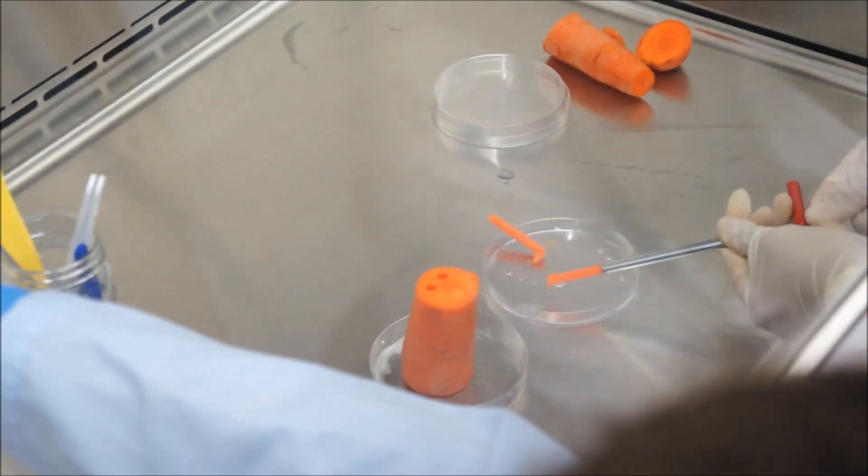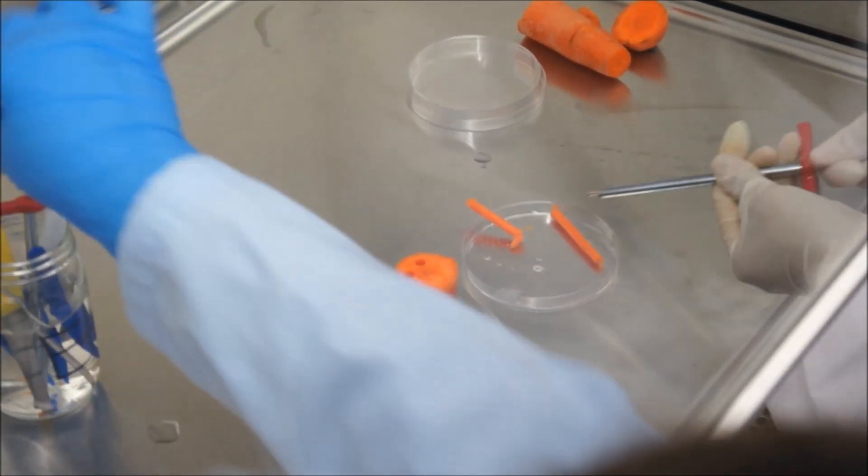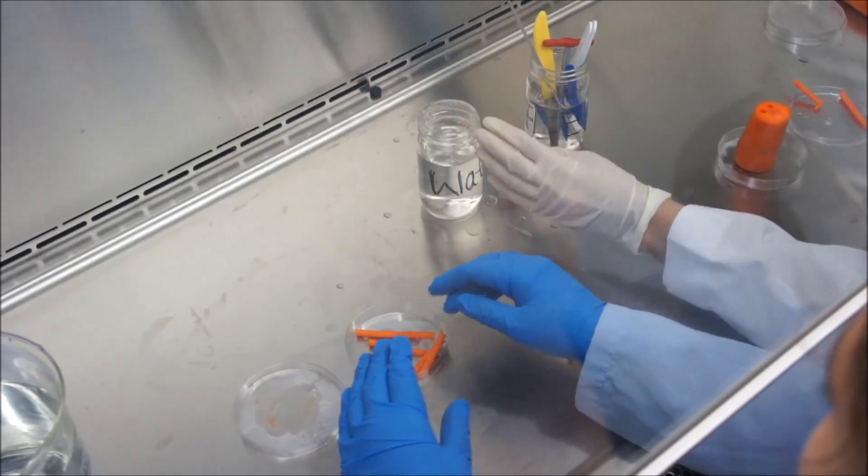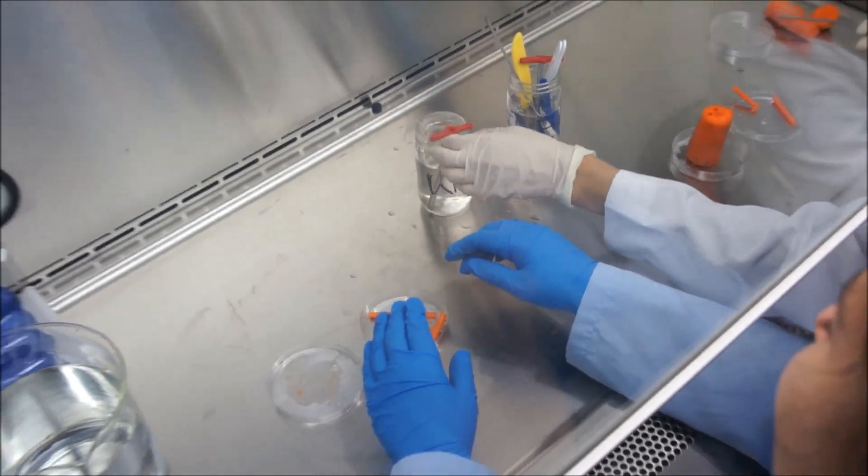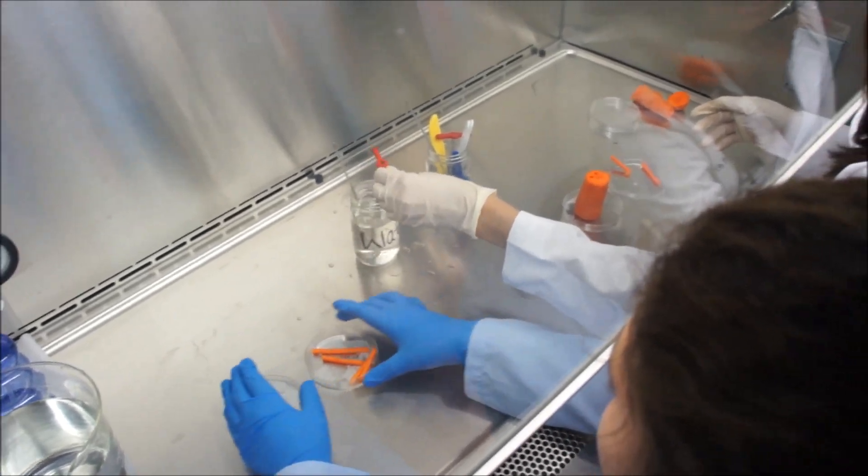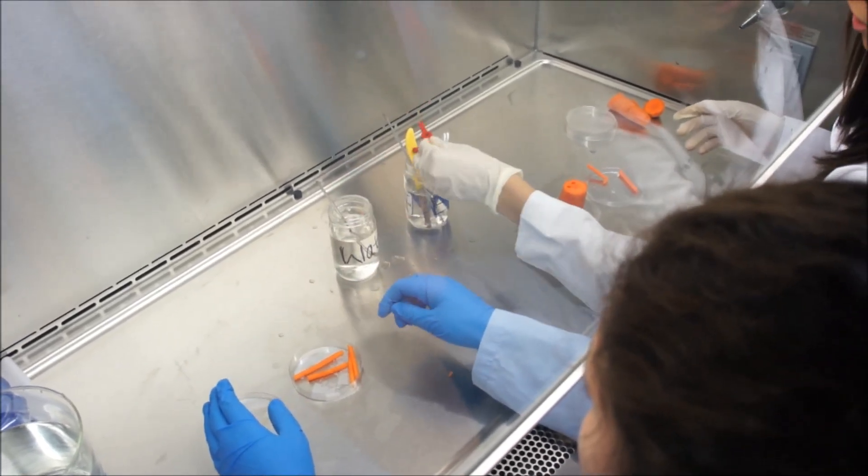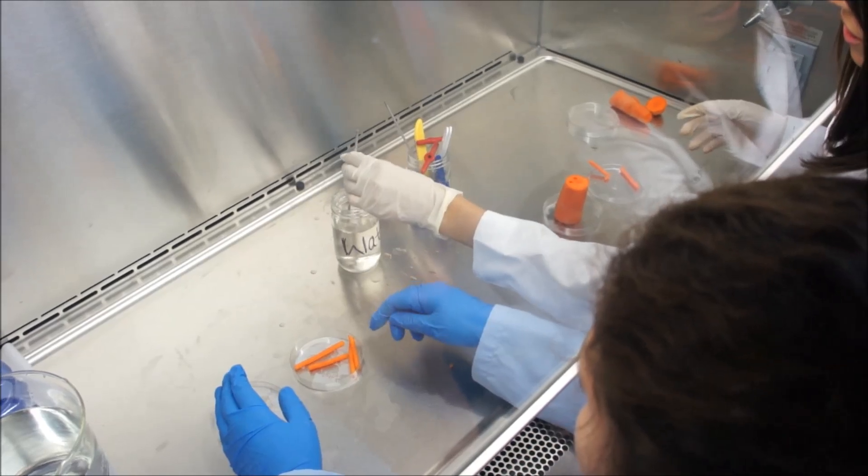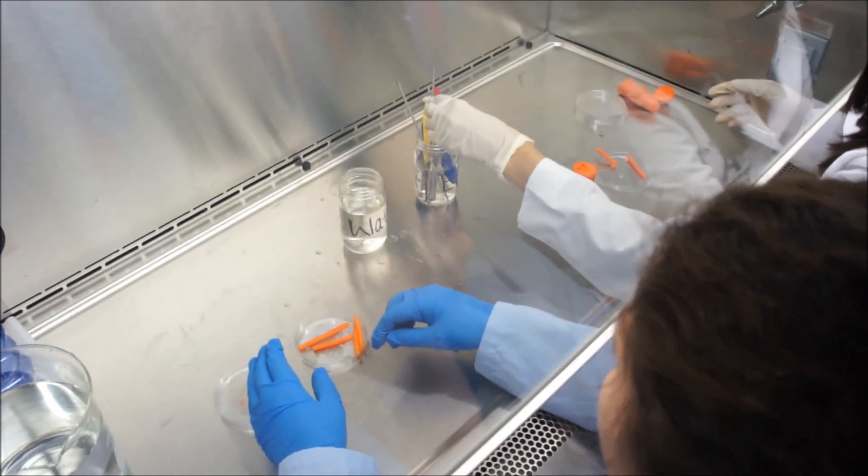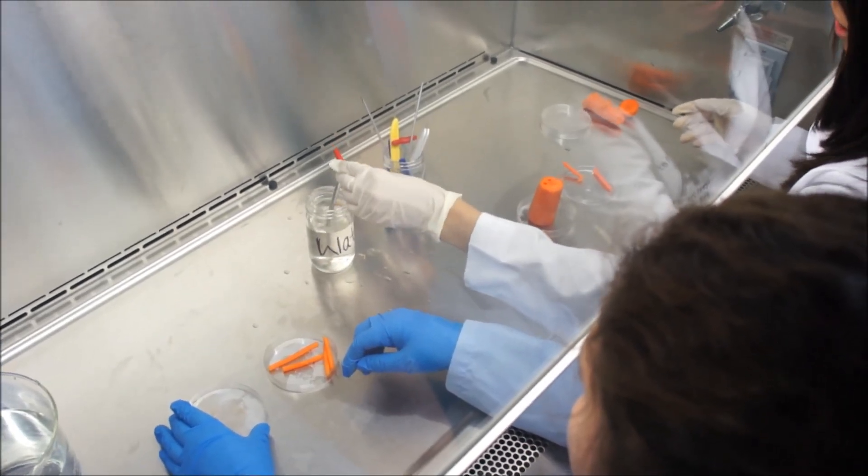Use a separate dish for four to six cores per group, and repeat until you have finished with all the carrots. Close the lid and set aside.